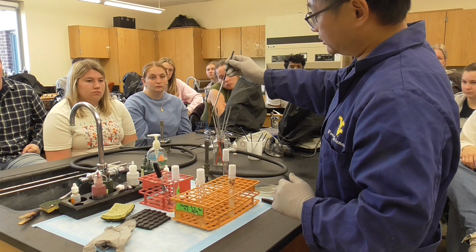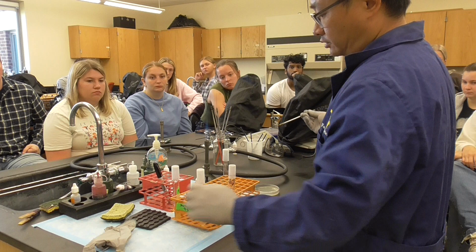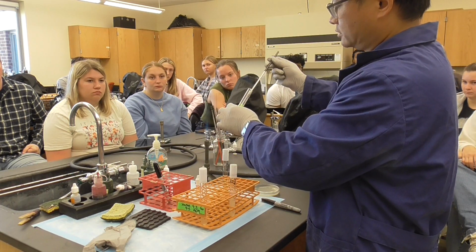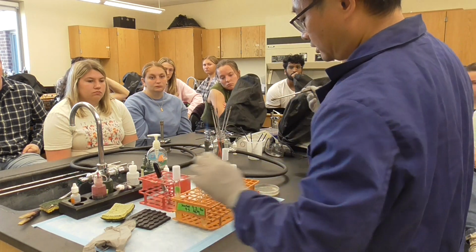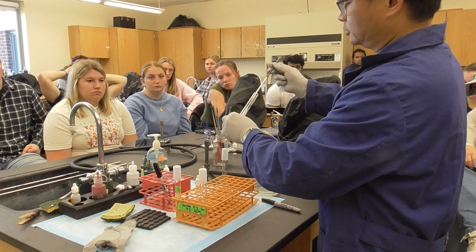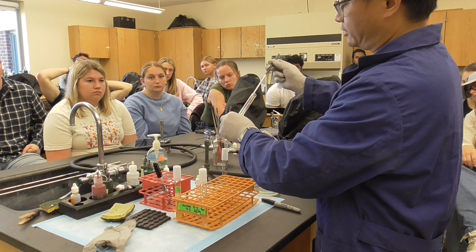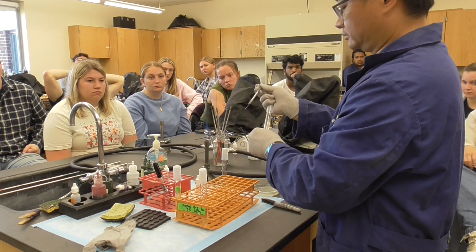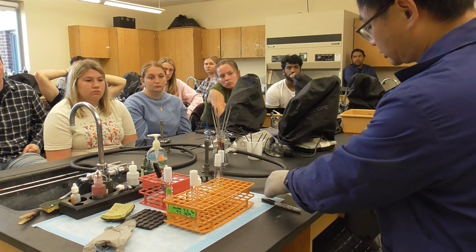Okay, now flame the loop again. Little bit here. Then what do we do? Go to the slants. Okay, Bacillus again. Hold on. Pick some bacteria on the side. Flame it. Go here. What we do is a zigzag streak. So flame the loop. Don't put it at the bottom. Just right here. Very gentle zigzag. Don't gouge the agar. Flame down. That's it. Okay, now this one is your homework, so it is important.